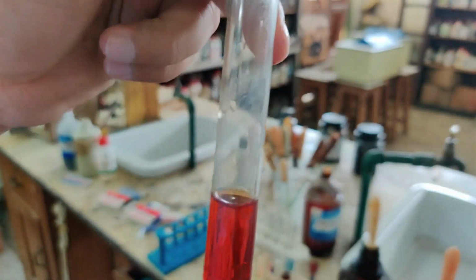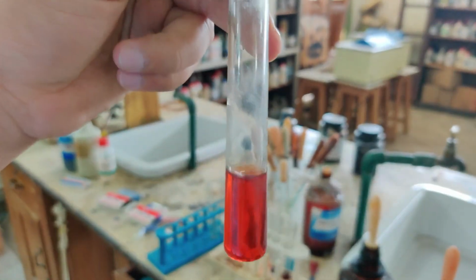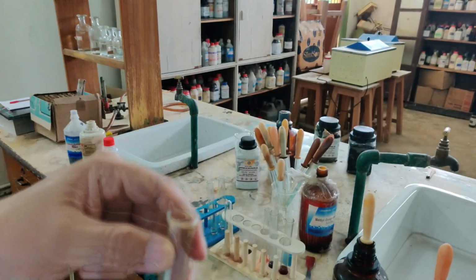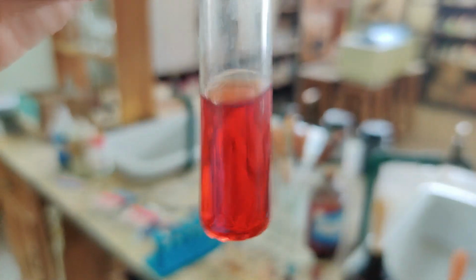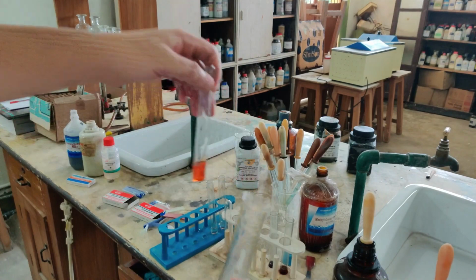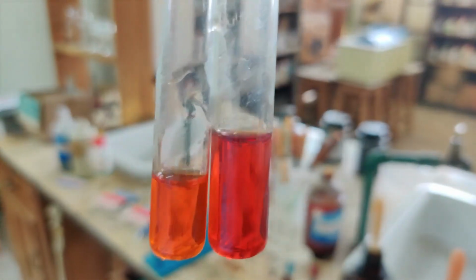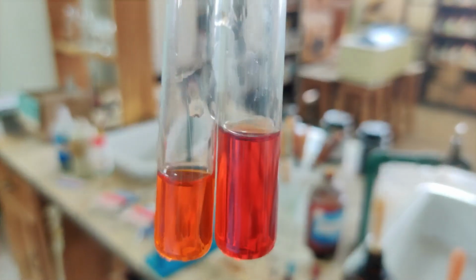So as I said, to distinguish pink, yellow and orange becomes a little difficult, but nevertheless there have been some color changes. Now let me show you. Now you may say, sir, all three colors were the same. So to show you actually that there has been some color difference, let me take the other one. You can see here the two. So there it is, the two of them. So there is definitely a color difference, as you can see, between the two test tubes.